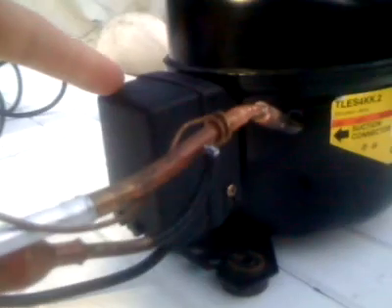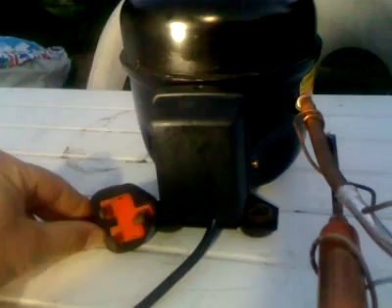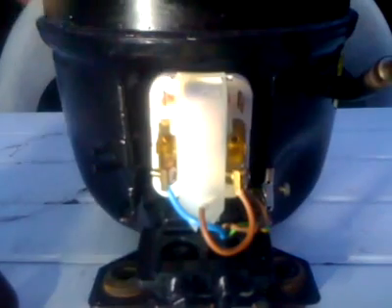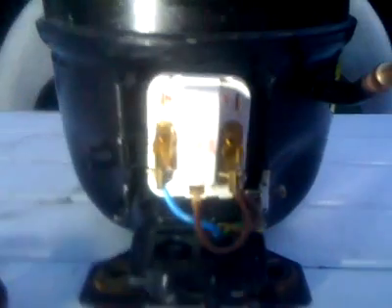Okay, TH has asked about the wiring for the compressor, so let me just open that up and show you that. There's the electrical connection box. Just one screw to get the case off. Most importantly, with the compressor unplugged for obvious safety reasons, I've just undone the screw down the side, and the case pops off like so, revealing this connection box, and then this safety cover just slots over the top.